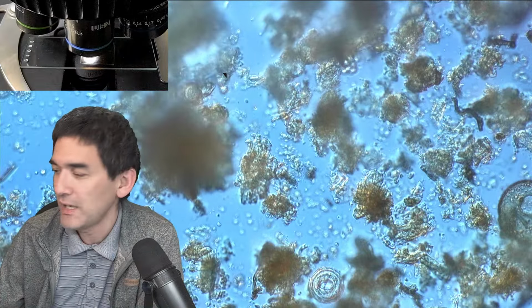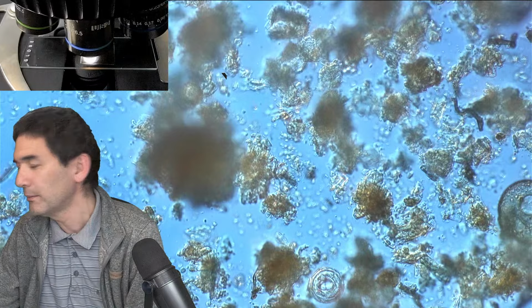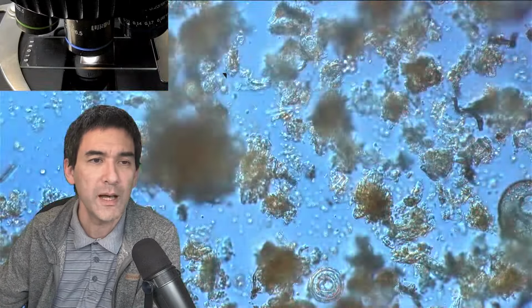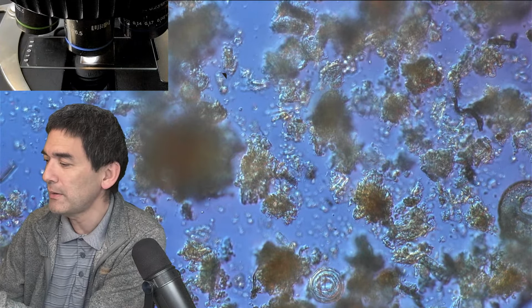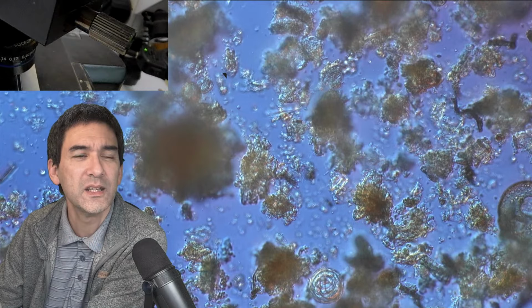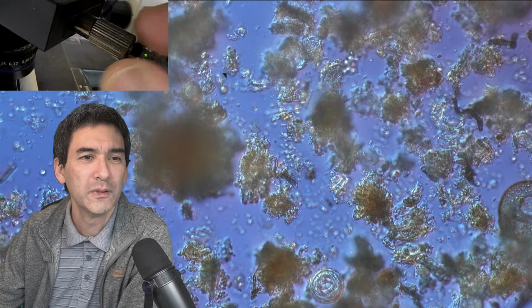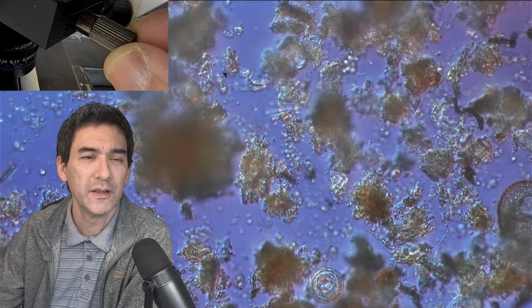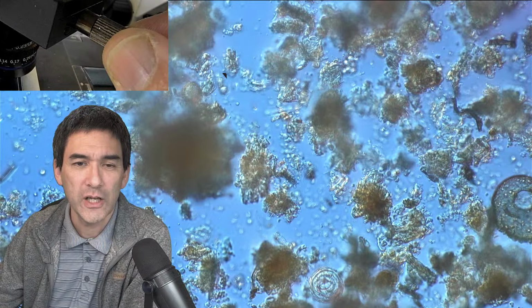It's not visible on the nosepiece stage camera when you change the color. That is correct. Okay, good. Thank you for informing me. So the question is, when I change the color, like this, what am I actually doing? So you kind of want to know. Maybe I'm able to show this to you. I'm able to swing around the, can I do this? Yes, here we go. Do you see this knob over here? When I turn this knob up here, it changes the color. It shifts something around in the slider, and I can change the color.